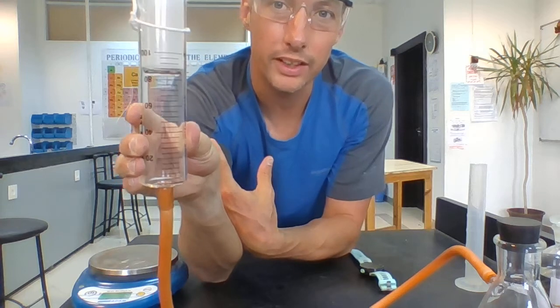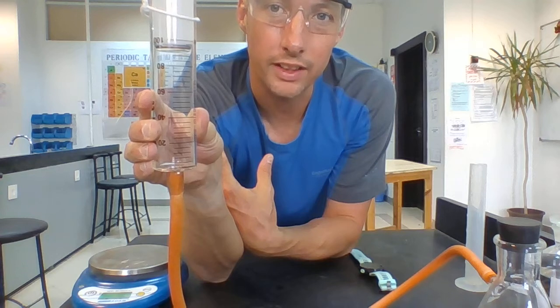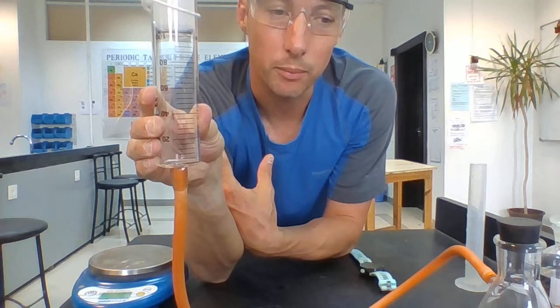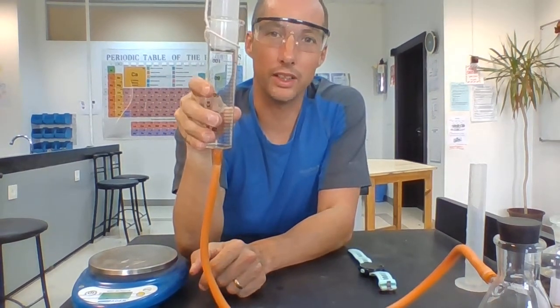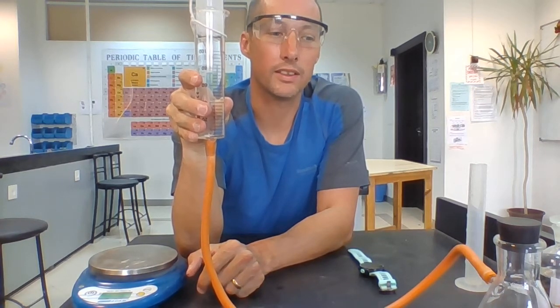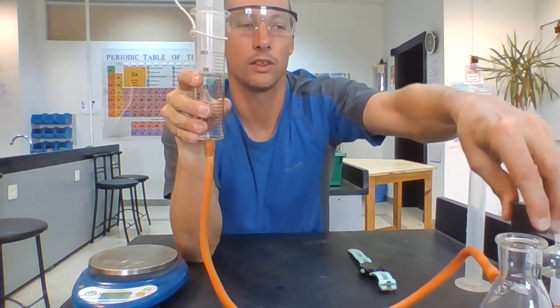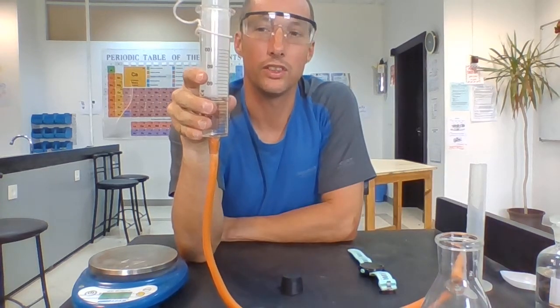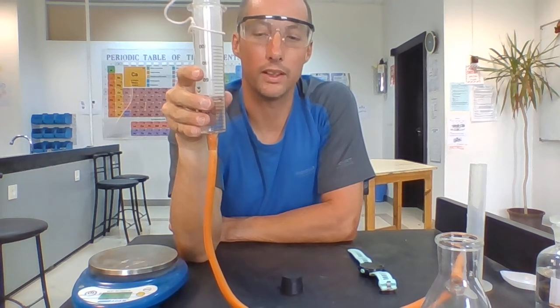Now once it goes over the scale, can you see the scale on my gas syringe is 100? Once I go beyond that, I can't really take any more measurements. So once I get to here, really that's the end of my experiment. Now, if I wanted a longer period of time, then what I could do is use less calcium carbonate, less acid, or I could use a bigger gas syringe. Now once it's got to the top, there's nowhere for the gas to go, so I'm going to remove the top of my flask, just because otherwise the gas is building up in the syringe and there's a possibility it could pop the pipe off.